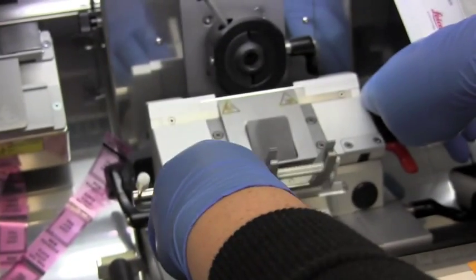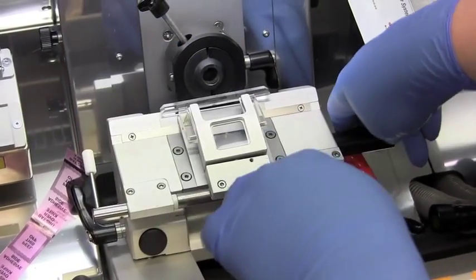This is the blade protector. To protect yourself from getting cut, usually keep that in the down position.